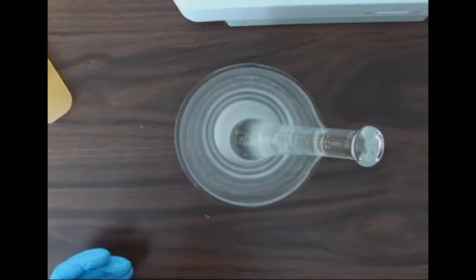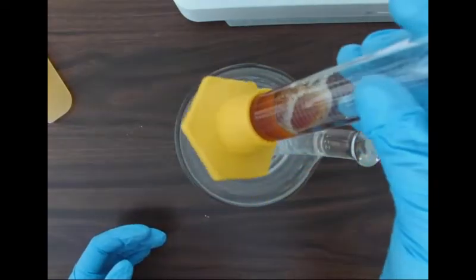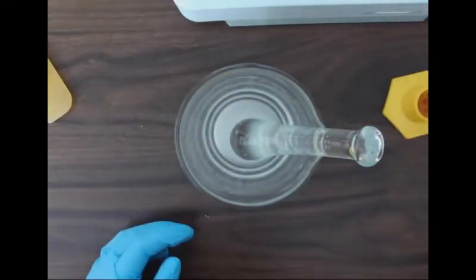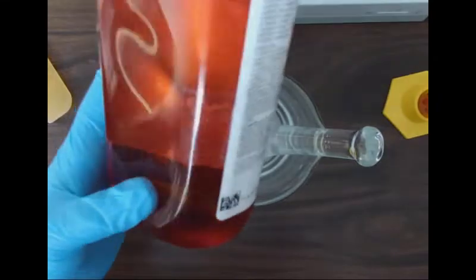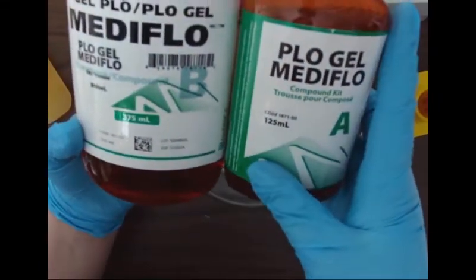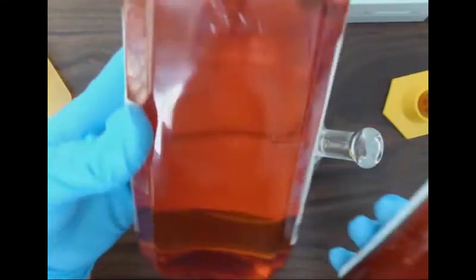Okay, so the next thing that I'm going to do here is I'm going to add part A that I have pre-measured here. So it's kind of that yellowy color. It's a little bit thicker. Yeah, again, that's that part A. There I am, just showing you part A and part B. Yeah, so they're both liquid, and we're going to mix them together.